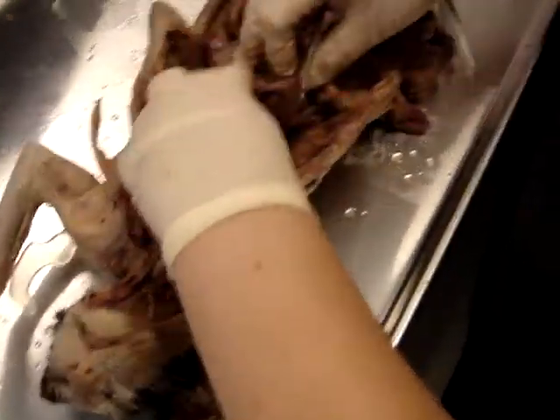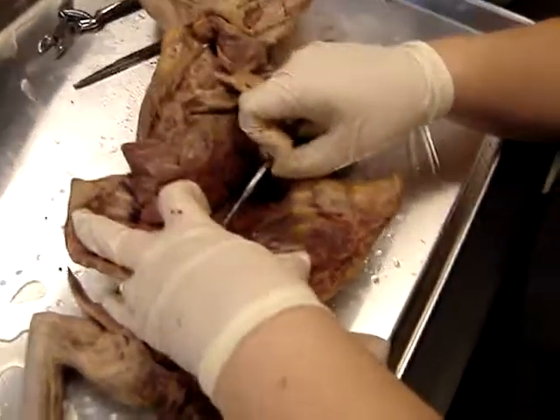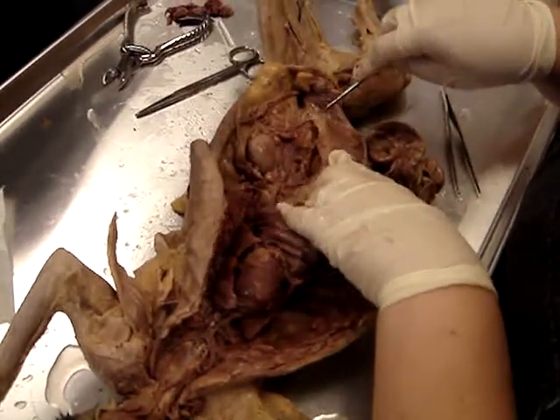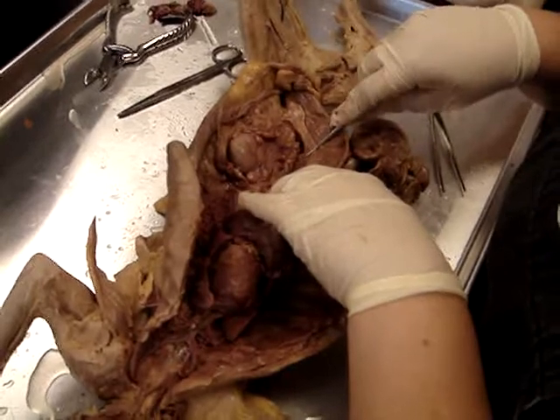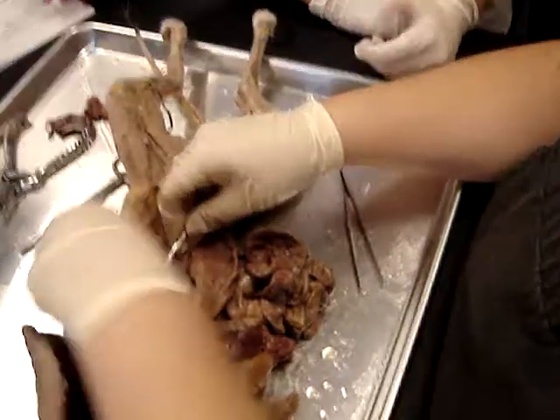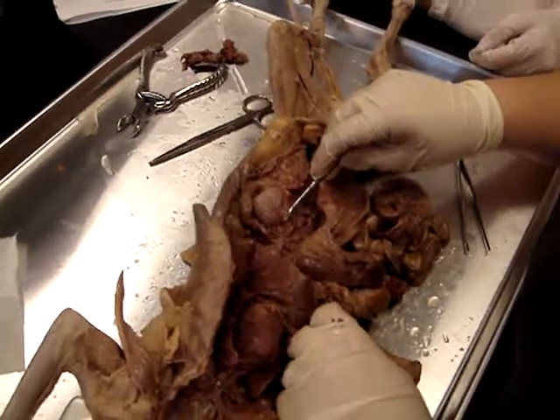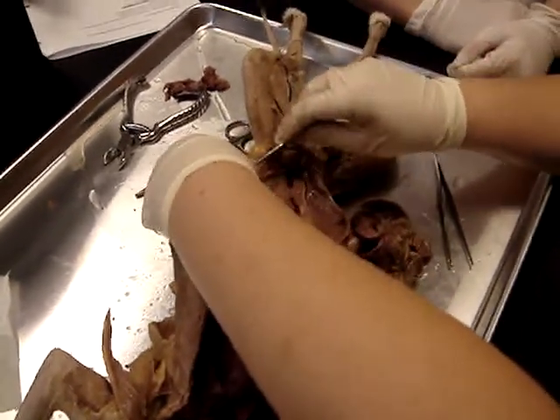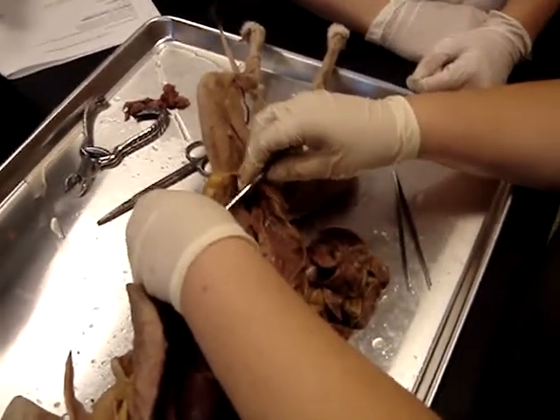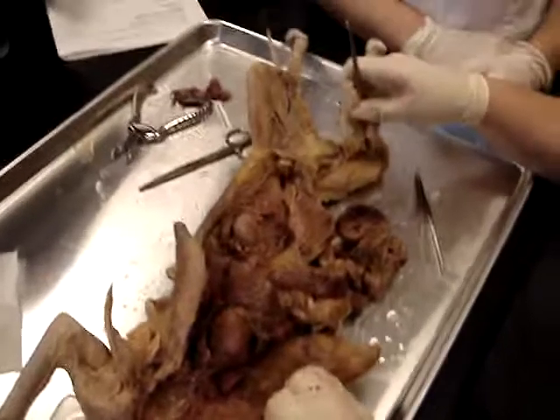All right, and then below the heart, the big blue blood vessel below the heart would be the inferior vena cava. Okay? And now, as far as abdominal veins, the only ones you have to know are renal veins, which are easy to find because they're close to the kidneys. Right? And then the gonadal veins are going to be, if you see one, next to whatever the gonadal artery is. So you can't see either one on this cat. Okay? And then the rest of the veins you can skip.